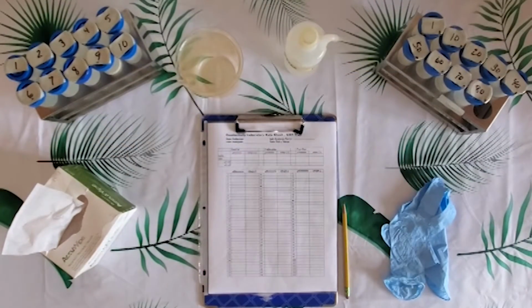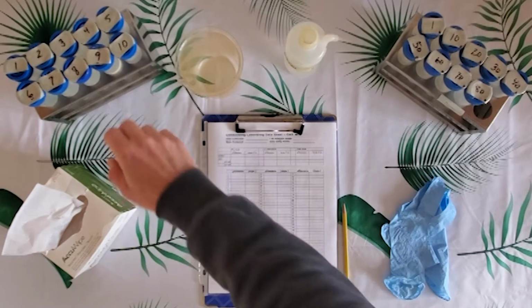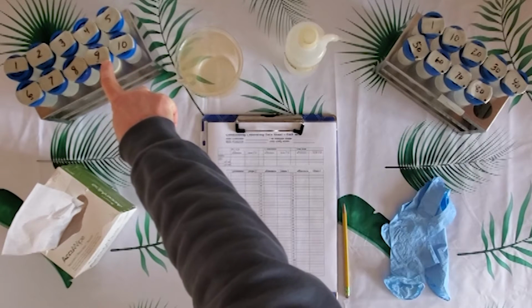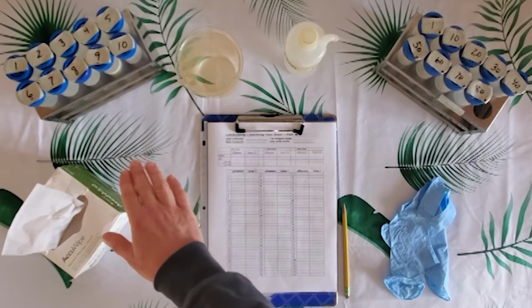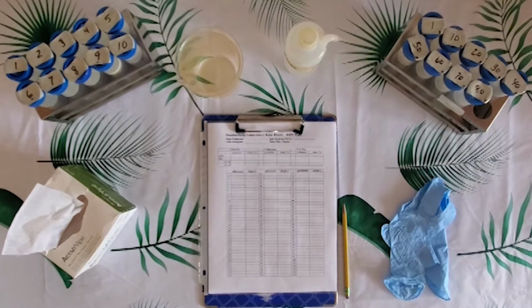Okay, first I'm going to start by talking about the items that are used across all of the tests that we'll discuss today in this training video: conductivity, pH, turbidity, chlorophyll, and optical brighteners. We'll start off with the test tube rack. This one here is numbered 1 through 10. We will have an additional 7 to 8 of these racks circulating amongst the tests that I just discussed, depending on the number of samples we get in that day.